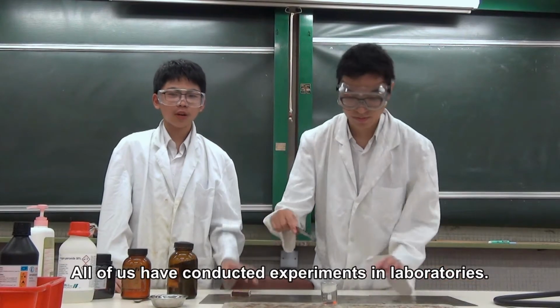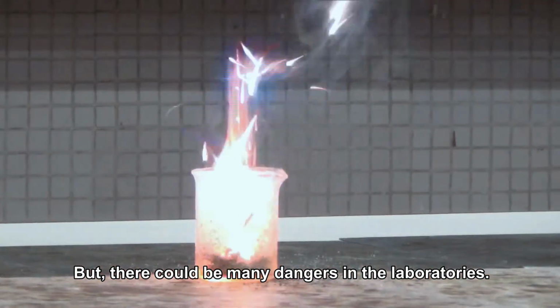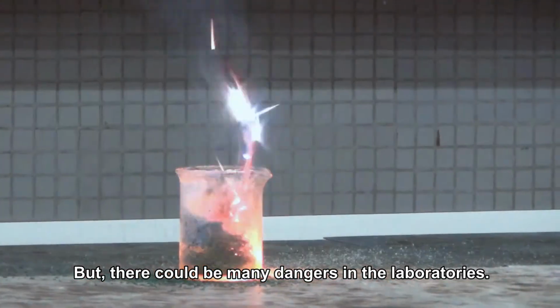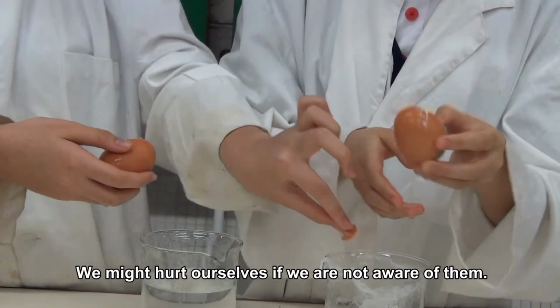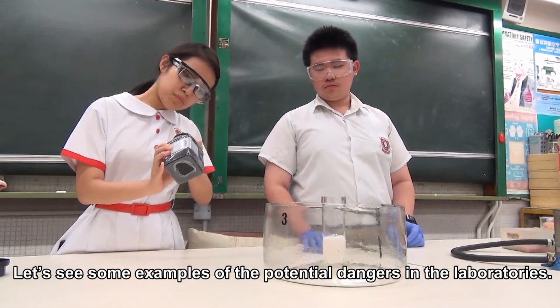All of us have conducted experiments in laboratories, but there could be many dangers in the laboratories. We might hurt ourselves if we are not aware of them. Let's see some examples of the potential dangers in the laboratories.